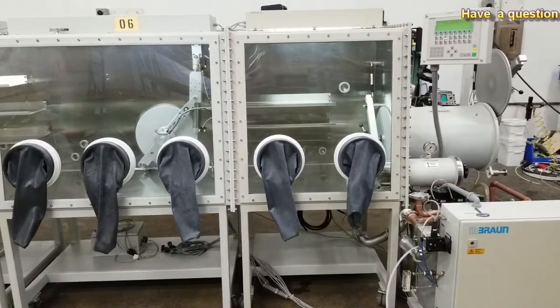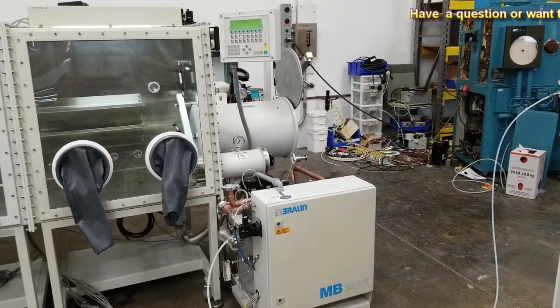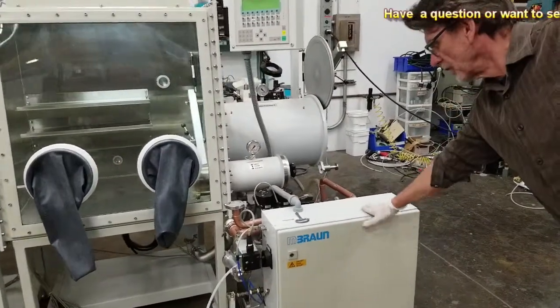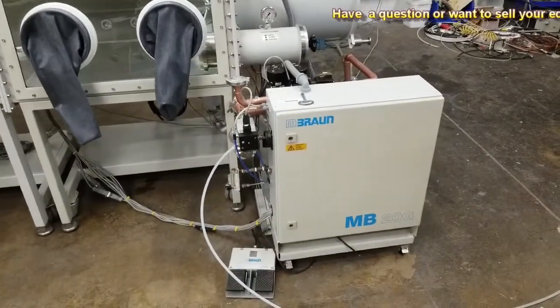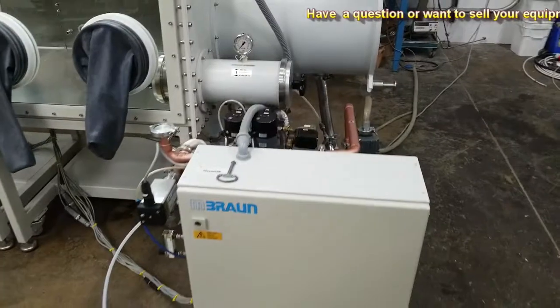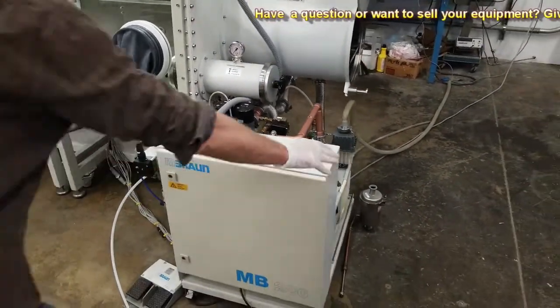I just want to point out a few of the changes I made that you requested while you were here. First of all, we moved the box here, so it's directly underneath the, if you come over this way a little bit more, you can see it's almost in line with the, you can see, almost in line.